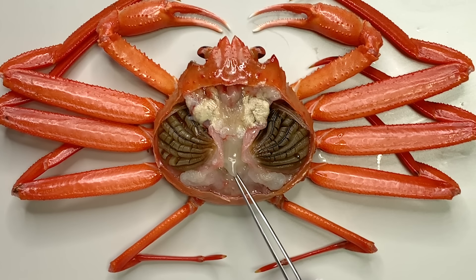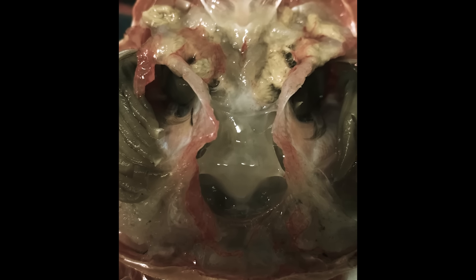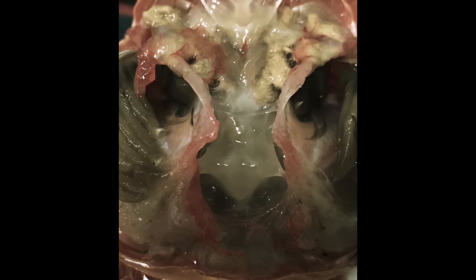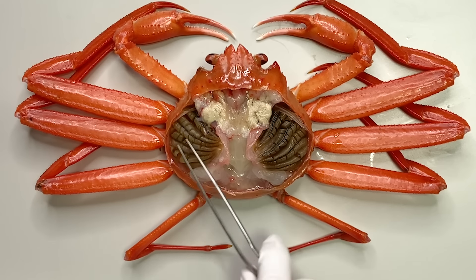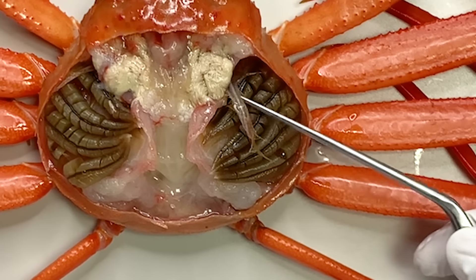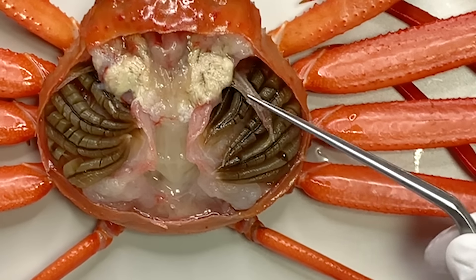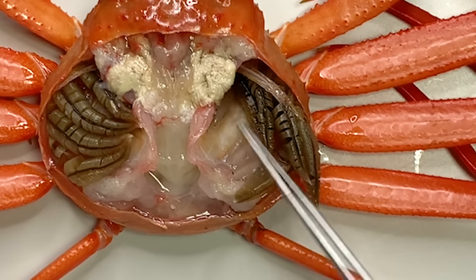Firstly, what you see in the middle is the heart. The crab's heart functions like this. And the organs on either side of the heart are the gills. If you look above the gills, there are appendages that work like windshield wipers to remove impurities from the gills. There is also one beneath the gills.